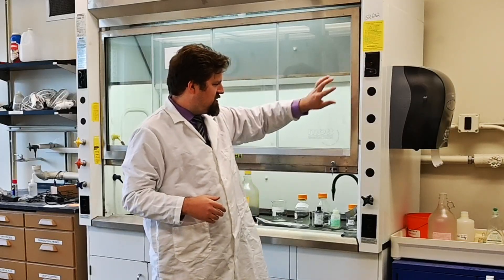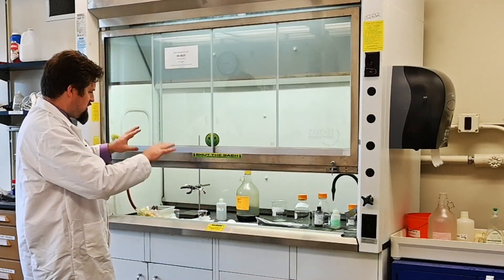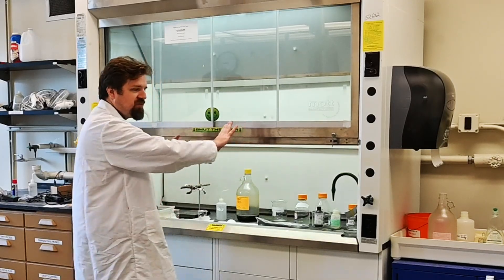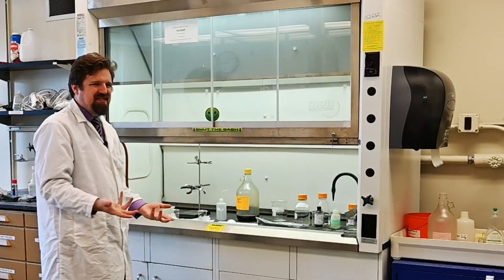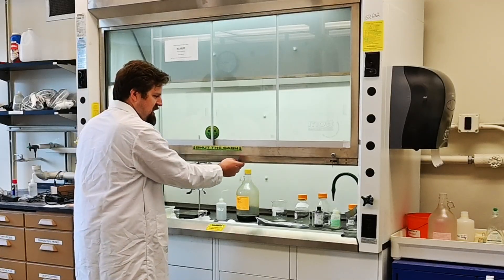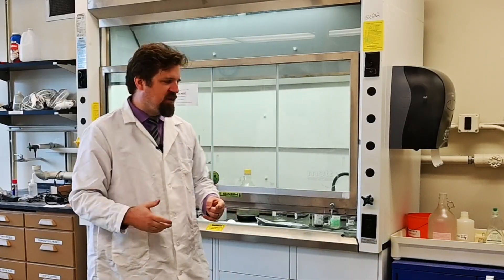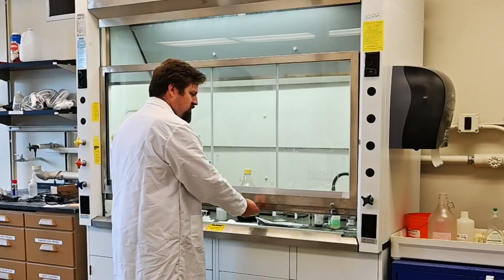Be aware that this big slidey door is called a sash, and a sash has appropriate places it should be. Some are marked with a maximum — you really shouldn't go above a certain point because if it's too high up, it's not really doing its job and you're letting the volatiles escape everywhere. Also be aware that if it's too low and you're constricting your movement, you might actually be putting yourself in more danger because you might knock something over. So find that perfect place for you.